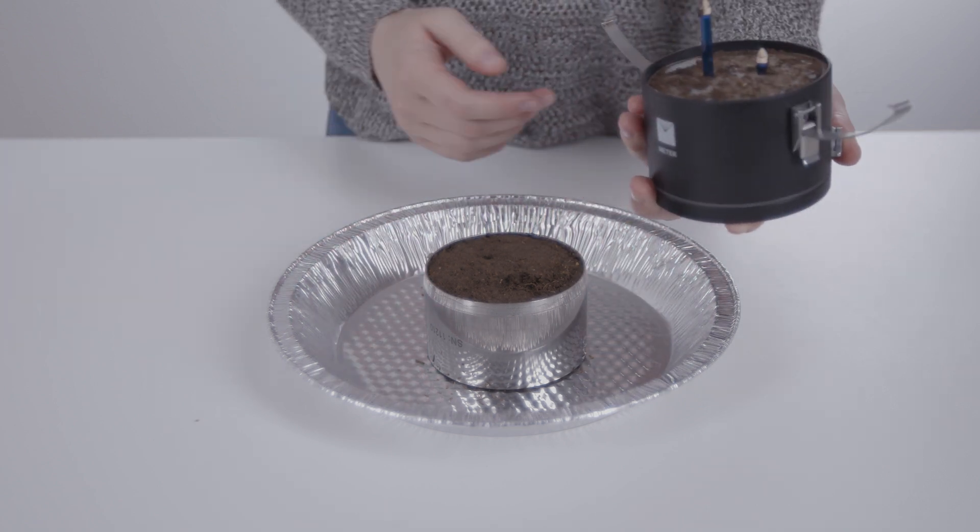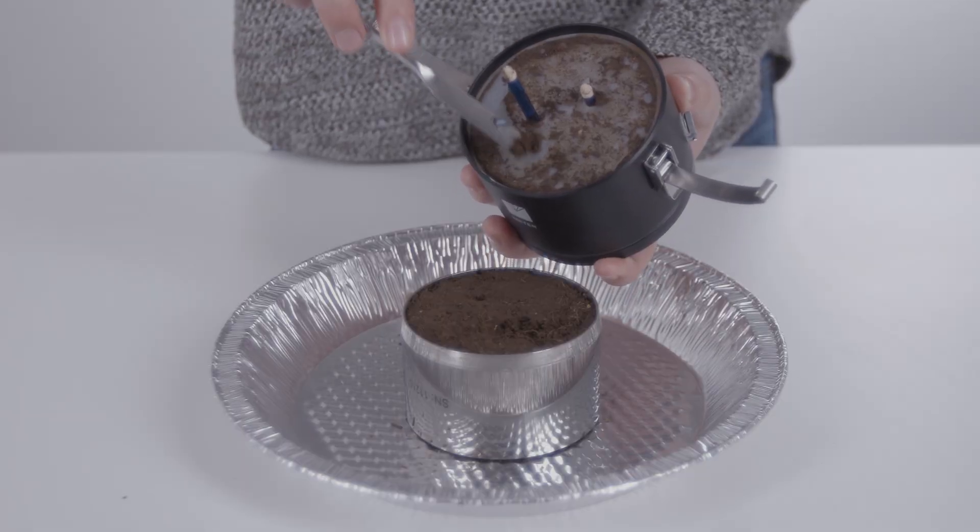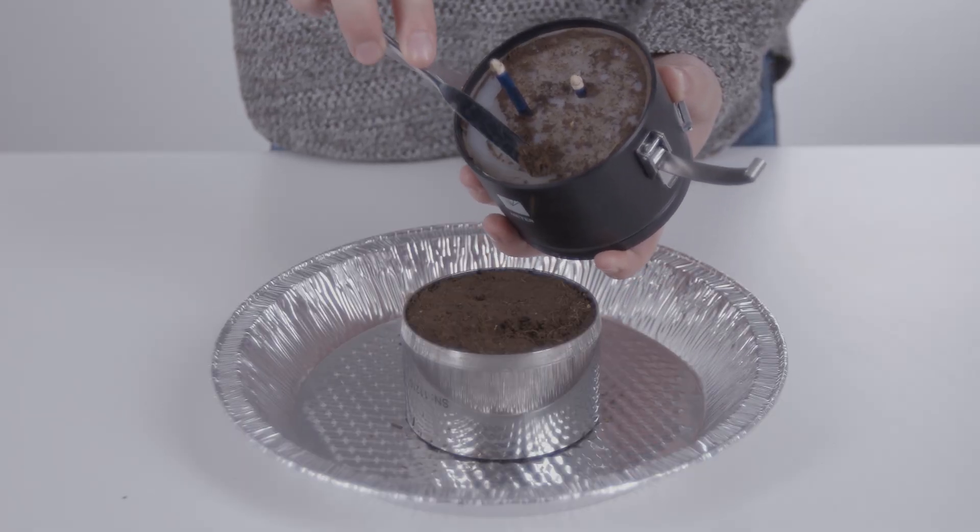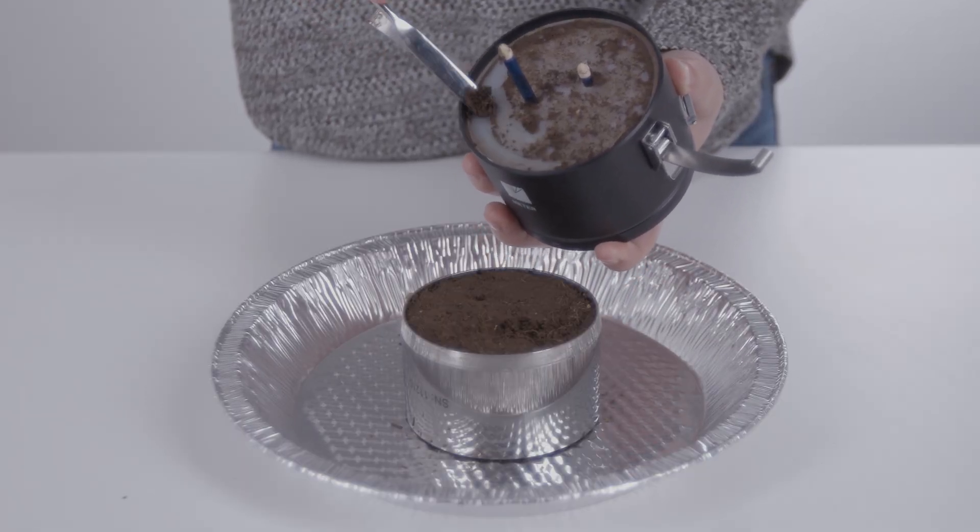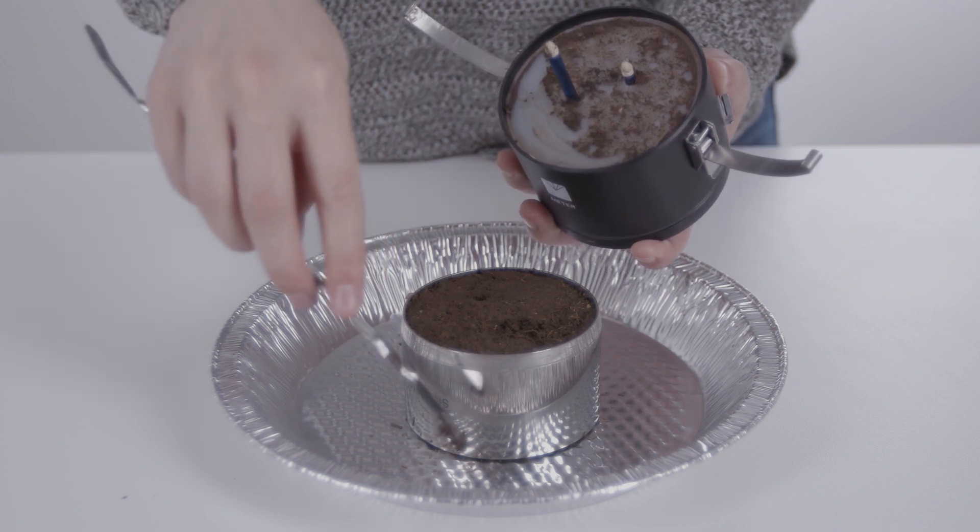If the soil sticks too tightly to the sensor unit, which is often the case with clay soils, see the manual. Set the sample into the drying pan and clean the sample ring and silicone gasket above the pan to avoid losing sample.